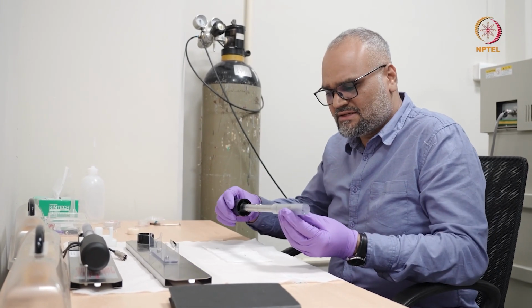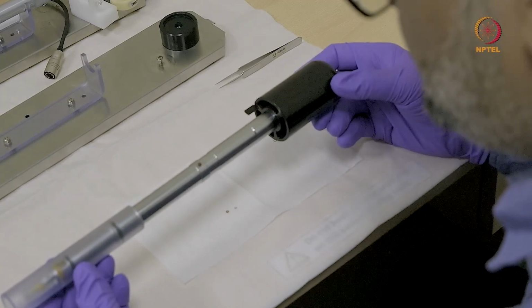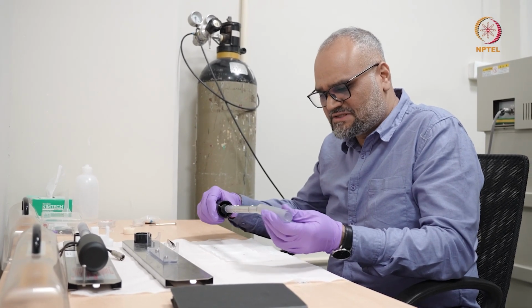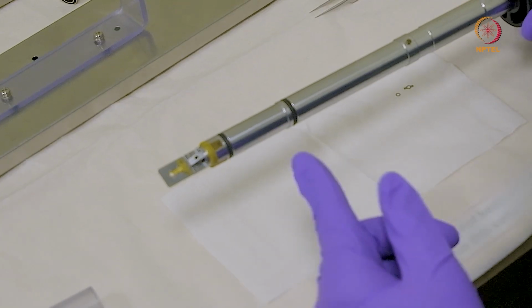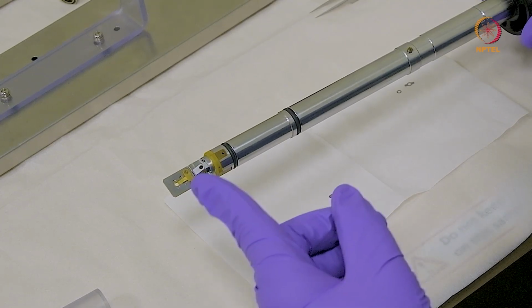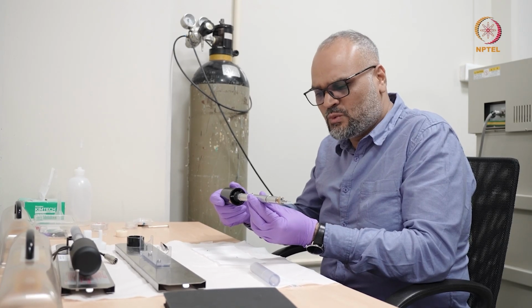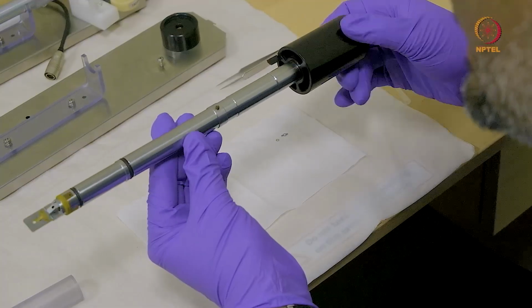So you introduce these into the microscope column by using a specimen holder. So what you have here is a standard single tilt specimen holder for the JEOL microscope. You have an equivalent version for Thermo Fisher microscopes as well. So the idea is there is a very small slot here, and in this hole that you see, you load this 3 millimeter disc or 3 millimeter grid, and then this goes into the microscope column. This is called a single tilt holder because this holder has only one axis of rotation, which is along the axis of the holder.